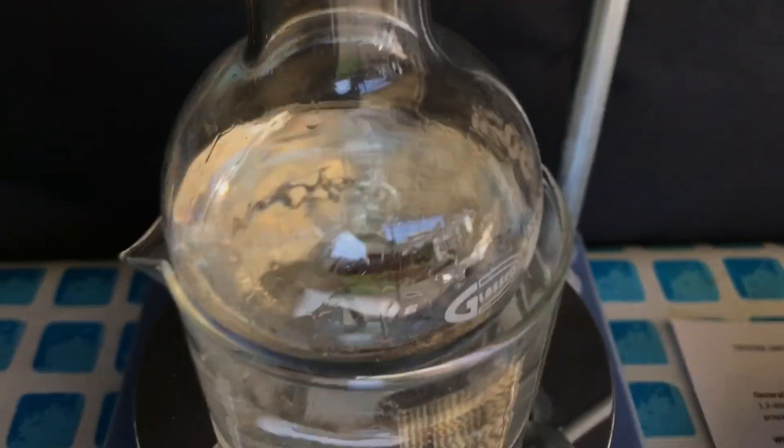You can have a closer look at the side without any stirring. At first the bromine drop goes in there, it's still a little red and afterwards it just becomes clear.